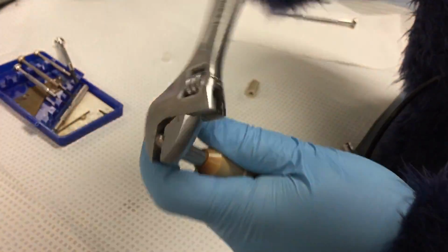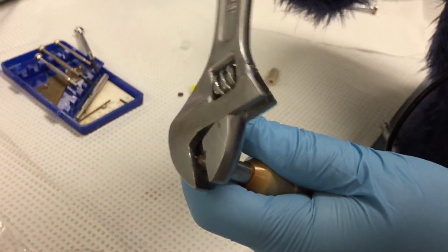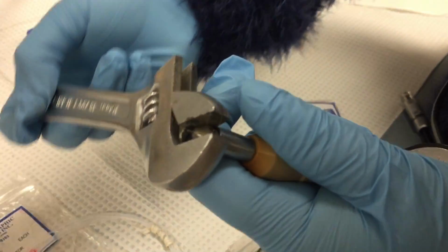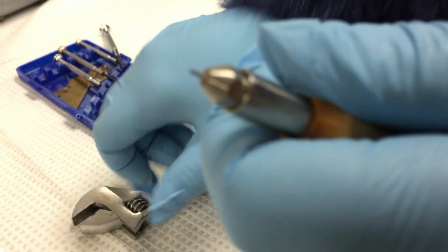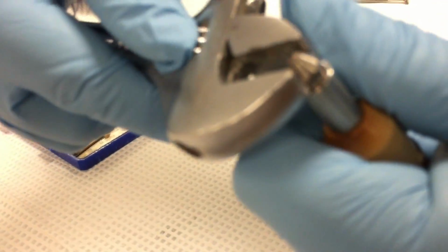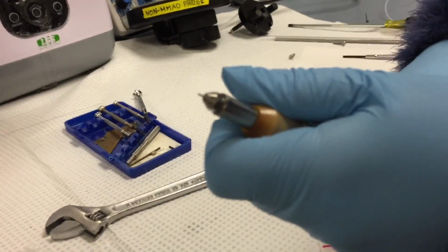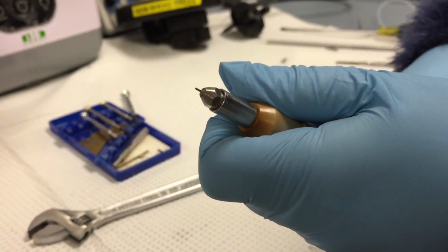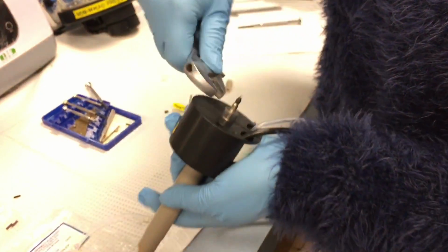When I screw on this nozzle head, I want to tighten it just enough so that the capillary only slightly emerges from the end, like so. Maybe just a touch more. So here you can see that the capillary is emerging slightly from the spray head. So that should be about right. So now we can tighten this nut.